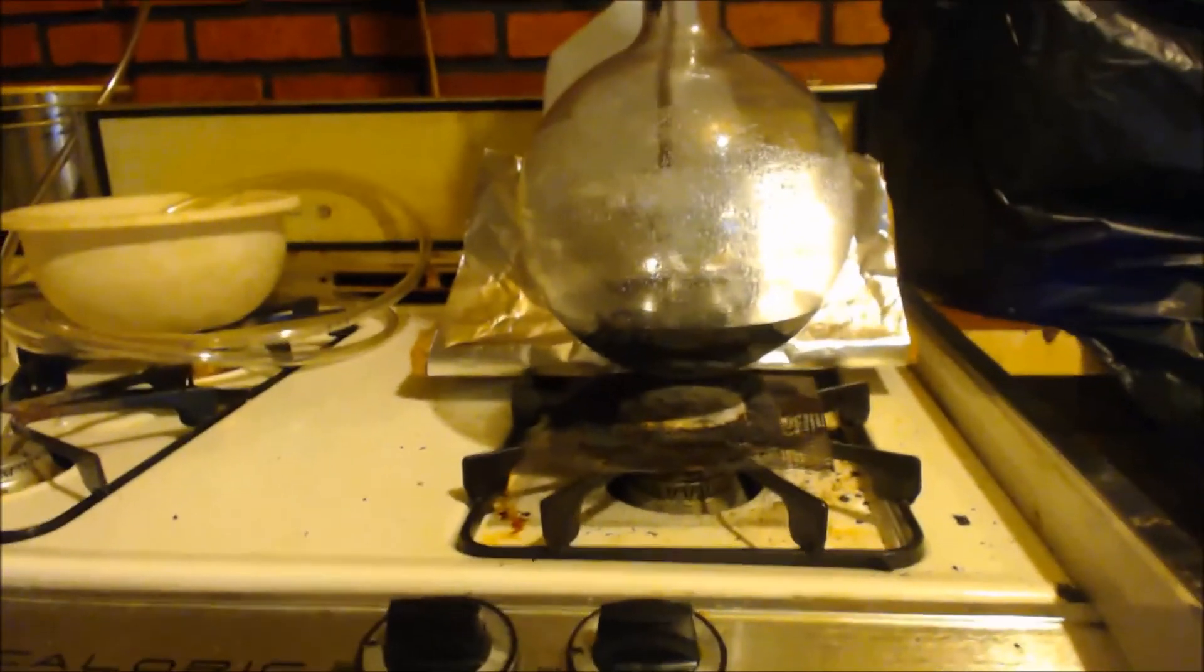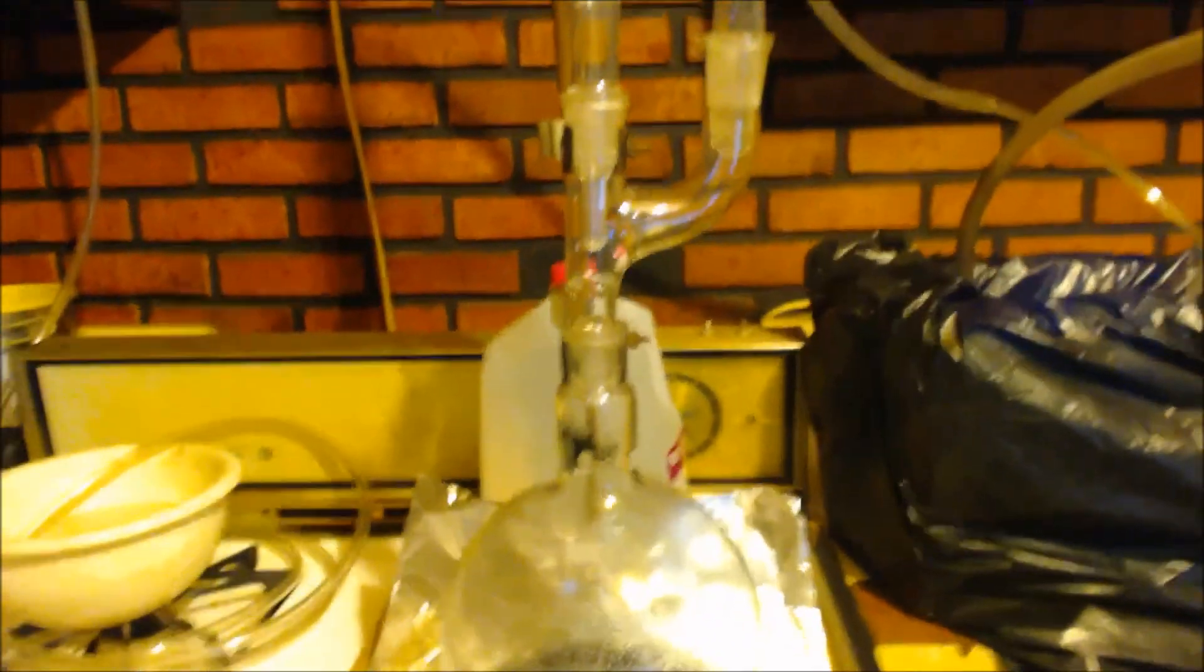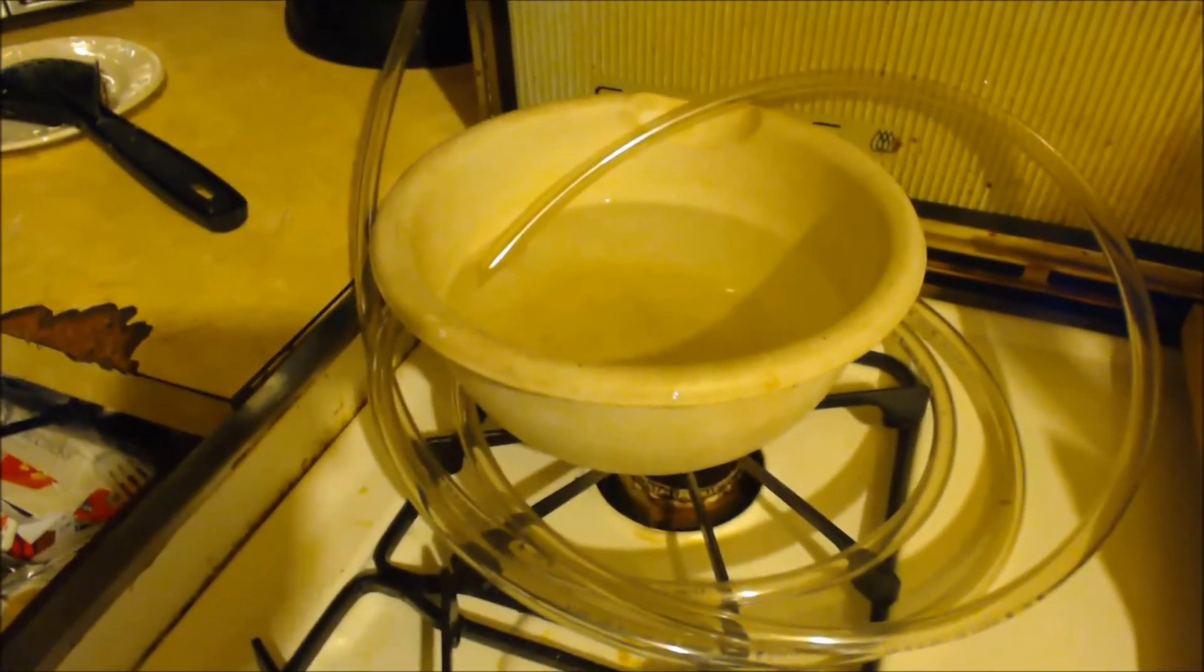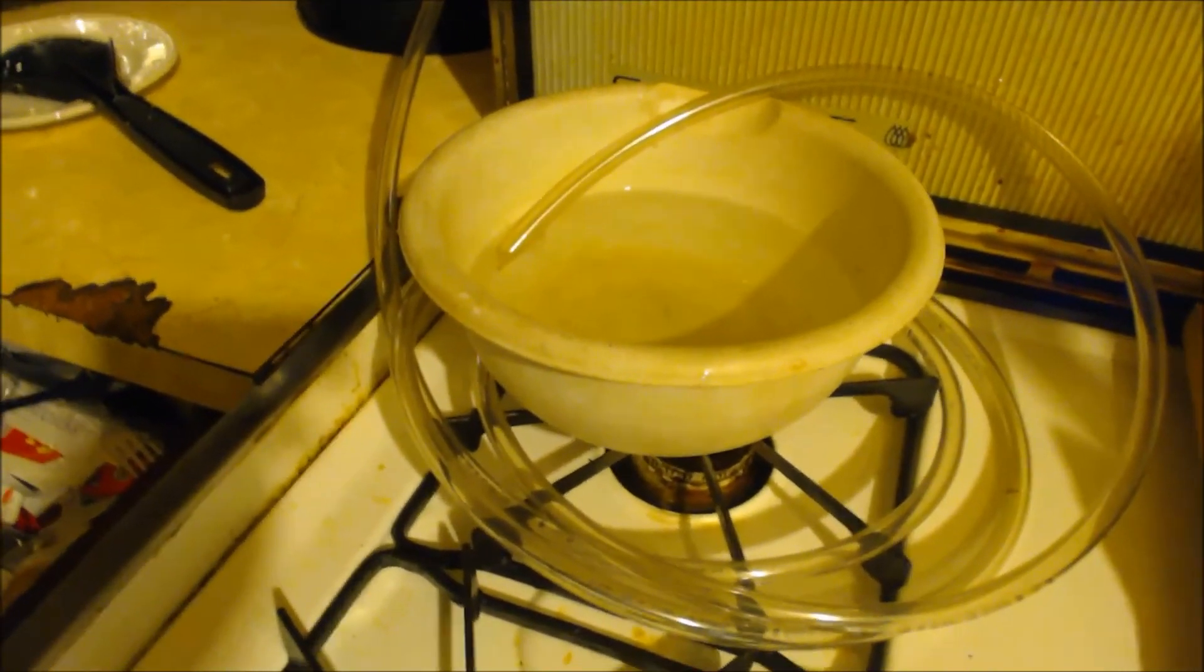All right. So I got my round bottom flask, right? Comes up to a two-way adapter. This is just capped. I just wanted to move my reflux. I just wanted to move my condenser over a little. And there's my condenser. And it goes up to this tube. The tube goes all the way around, down around that bowl there and inside the bowl. And I have sodium hydroxide water there. Just a little bit of sodium hydroxide. So I'm just going to heat this up and hopefully we'll complete this reaction.